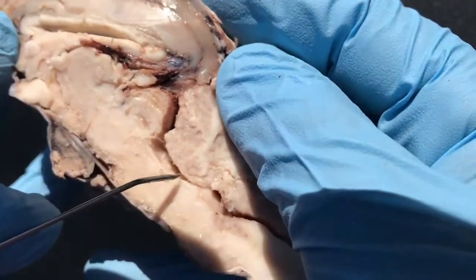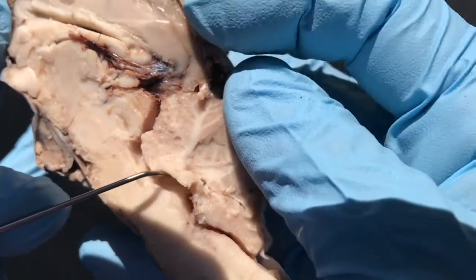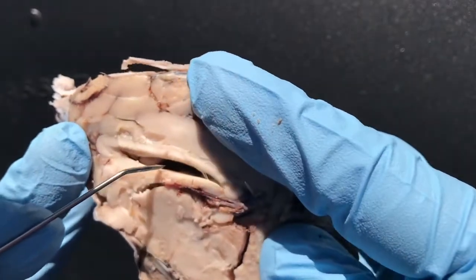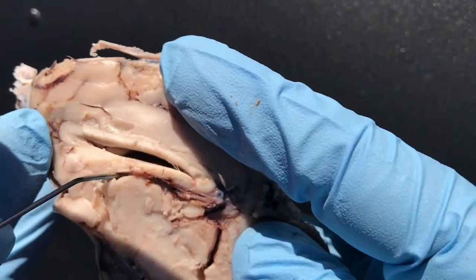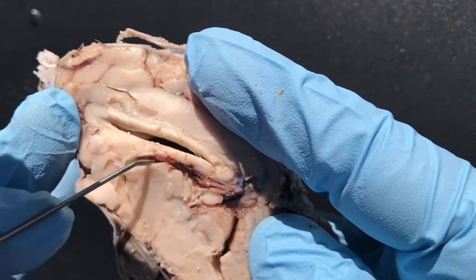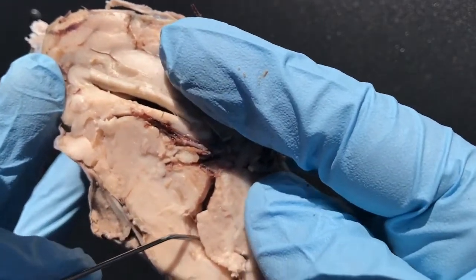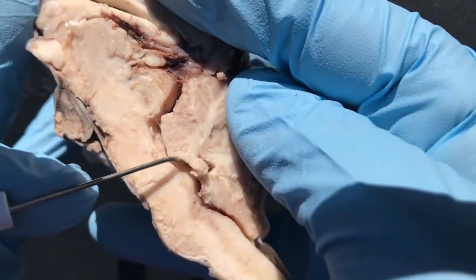And then finally there's a little pocket right here that goes into the cerebellum, and that's the fourth ventricle. So again, all the ventricles: you have your two lateral ventricles, one on the right and one on the left. Then you have your third ventricle, which goes all the way around the thalamus. Then the cerebral aqueduct, and finally your fourth ventricle is right there.